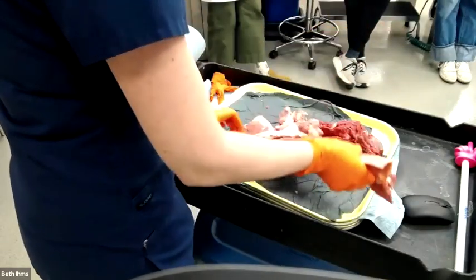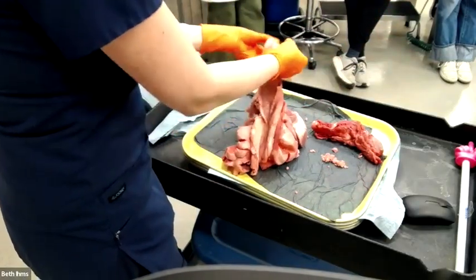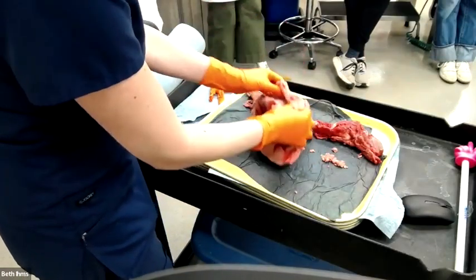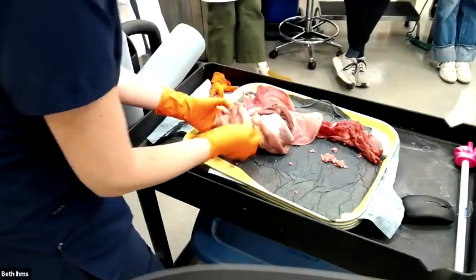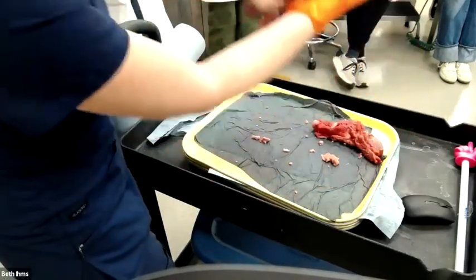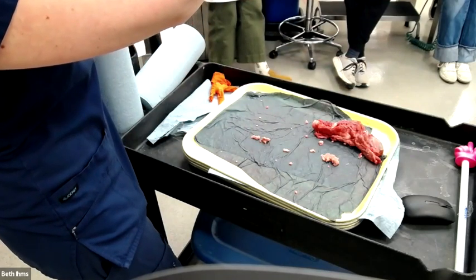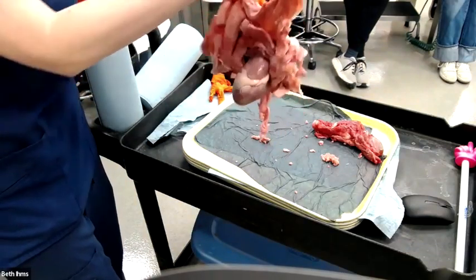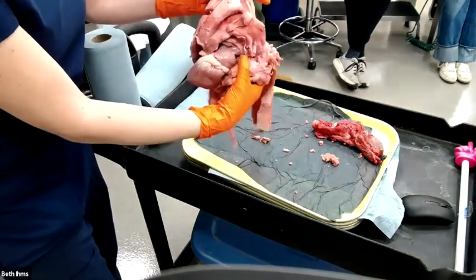All right, so this is a pluck. We have tongue to lung, so you can find a bunch of organs. We have trachea. We have esophagus, full length. We have aorta here. We have lung. We have heart. And then we have this thing, which, anatomically, this is the way it is in the animal, so we are cranioventral in the thorax. We're cranial to the heart. It's the thymus. So this tissue right here is or was the thymus.